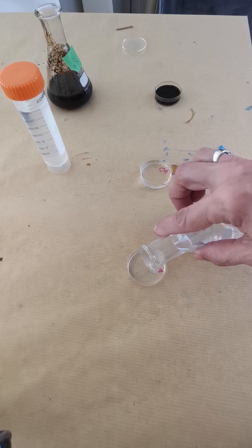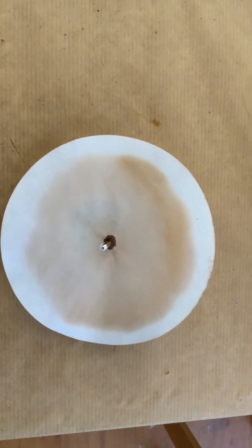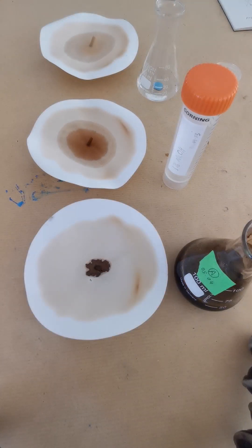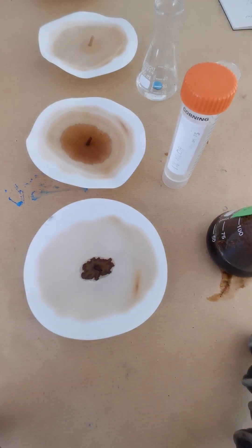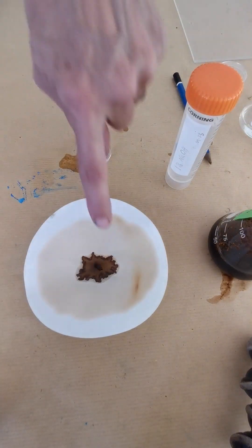Finally you are ready to put into each of the small Petri dishes your solution to be absorbed by capillarity. Best is done in the dark — here for demonstration it's outside. The bottom is your soil absorbing by capillarity. The two above are controls: the top one is just water, the second one is just sodium hydroxide. You see they also color your filter.